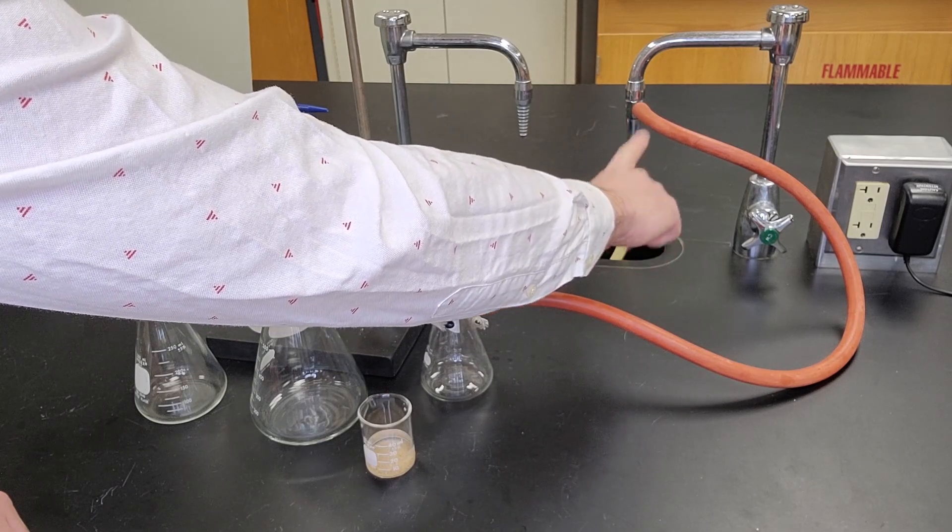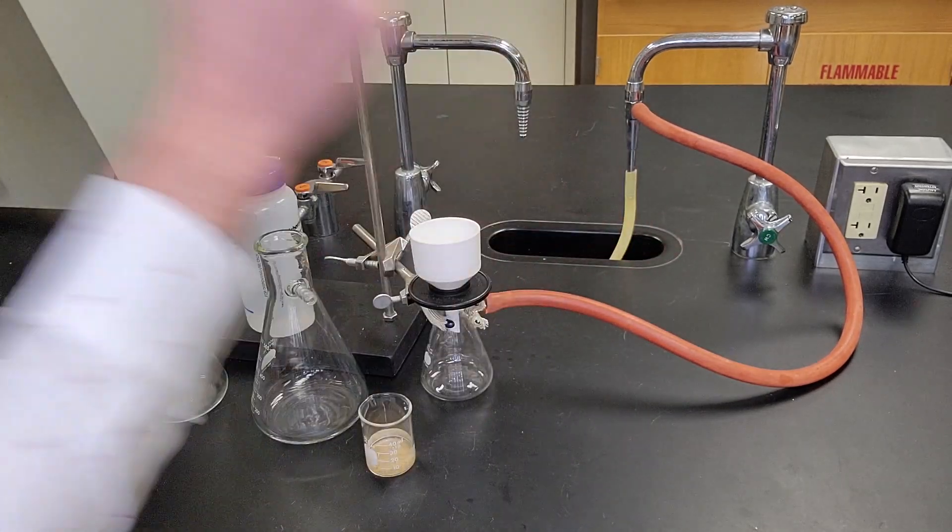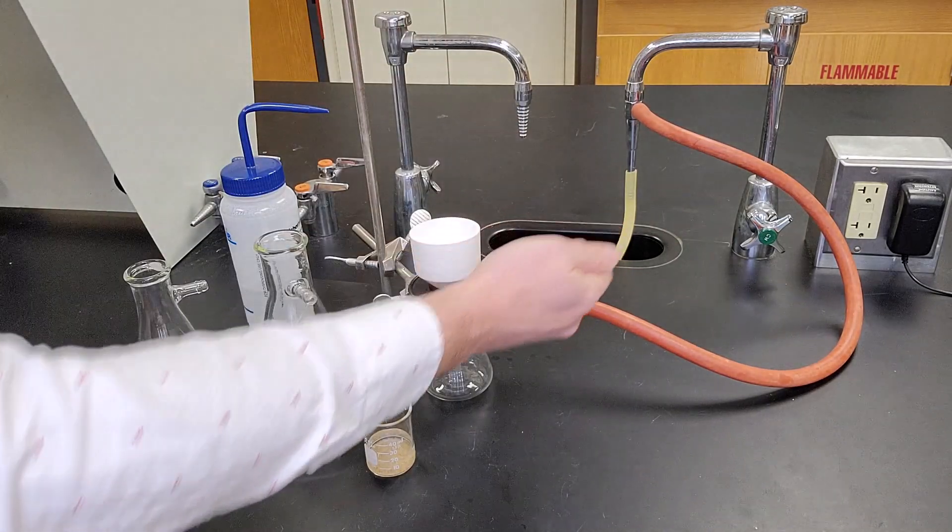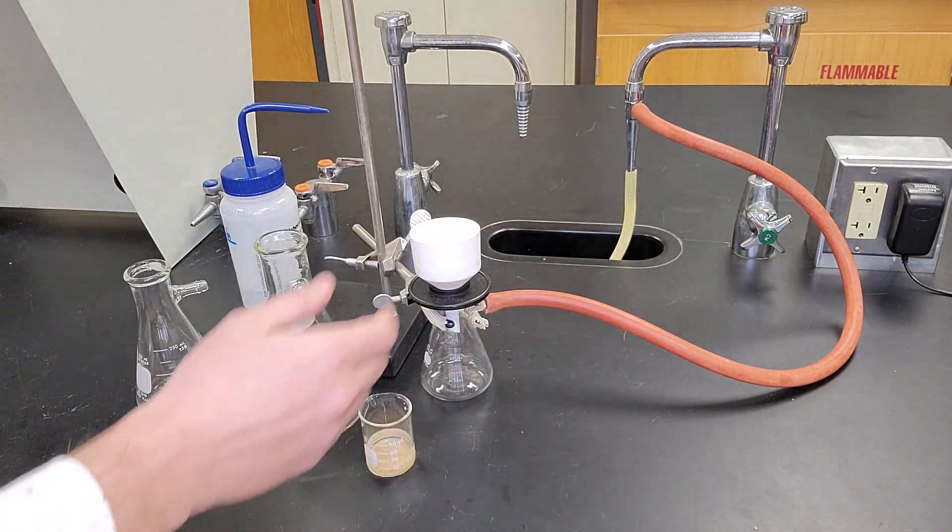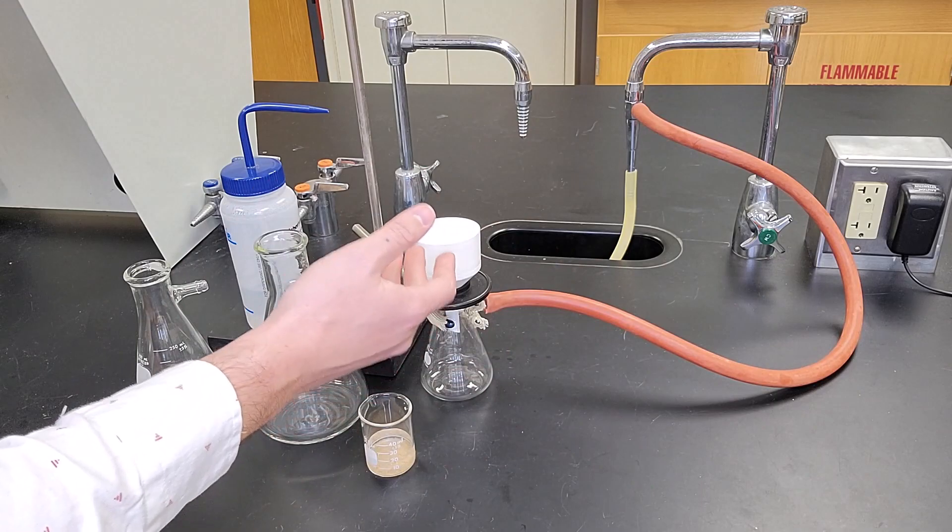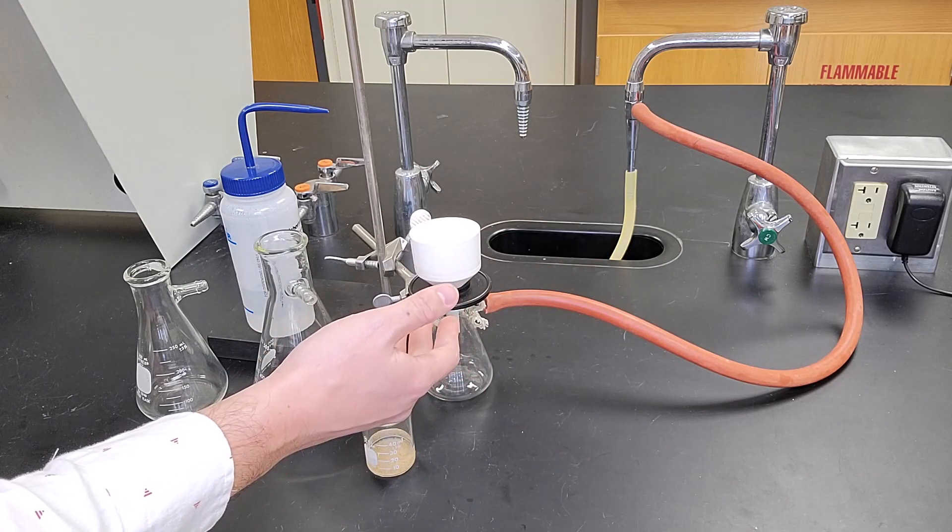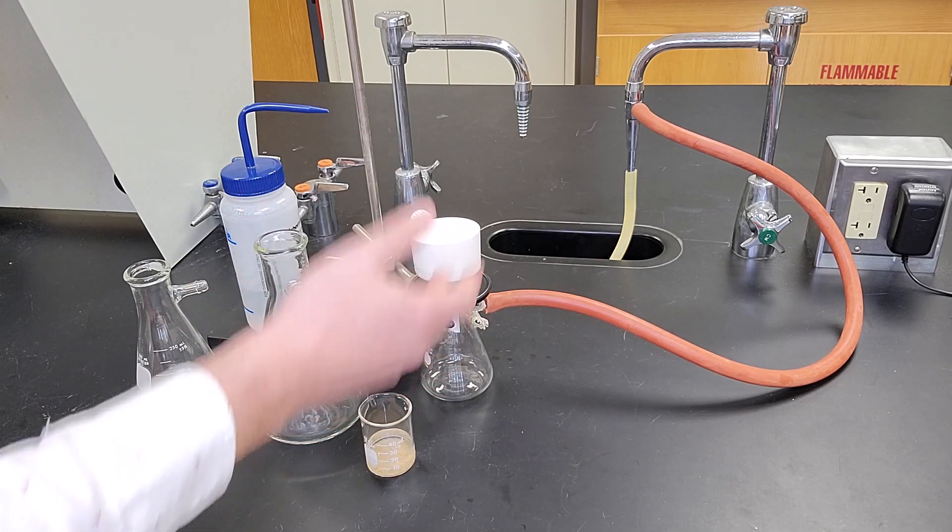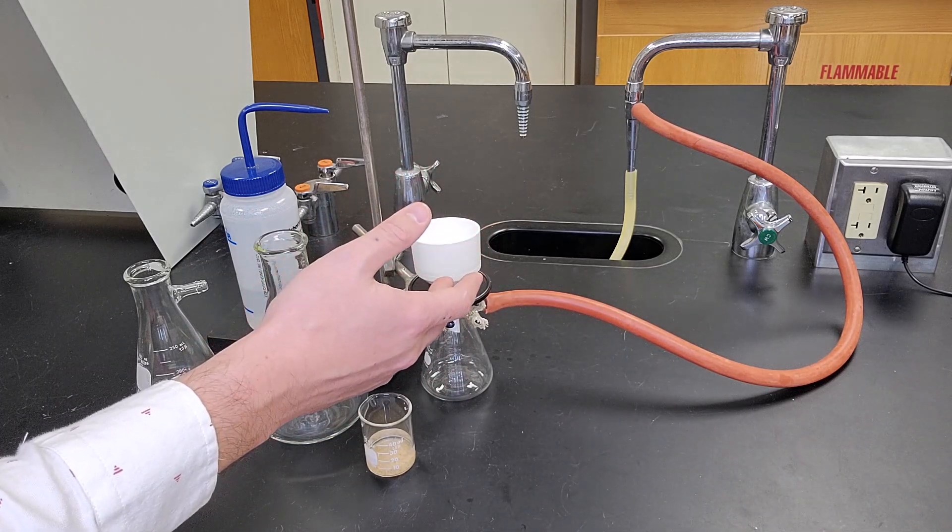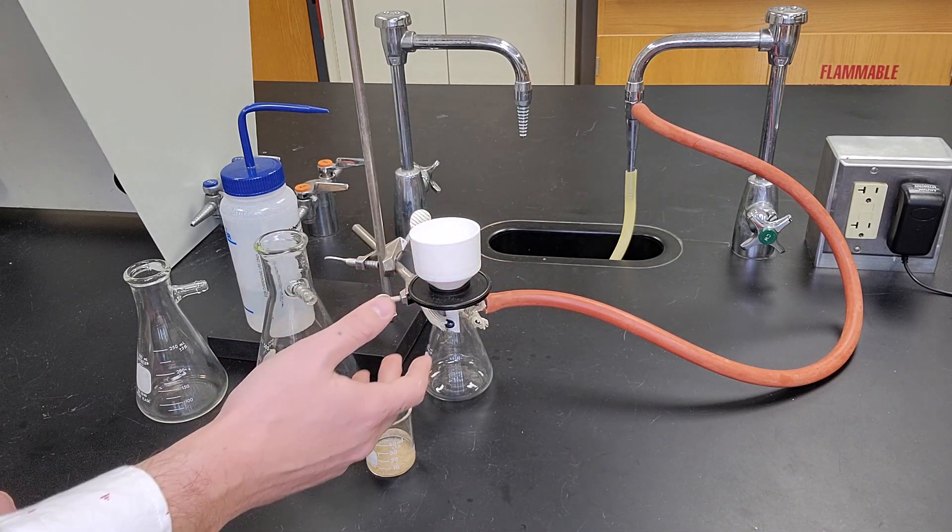The water will go directly down and the negative pressure created by the water flow will create a vacuum. This might get a little bit loud with the sink running, but hopefully you'll be able to hear me explaining it.